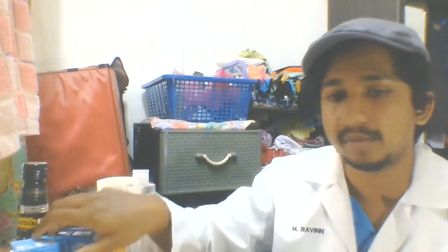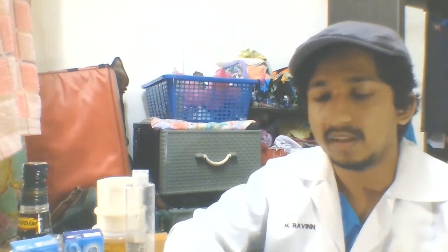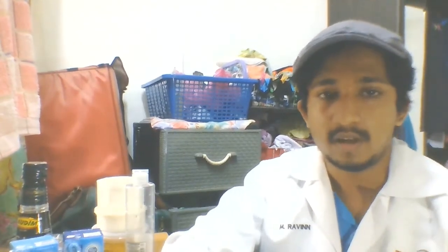Besides that, the type of milk is the manipulated variable of this lab experiment, because I'll be using two types of milk, low fat milk and full cream milk. Besides that, the amount of casein precipitated is the measured variable, which I'm going to record in the results later on. Okay, so I'm going to continue with the experiment now.